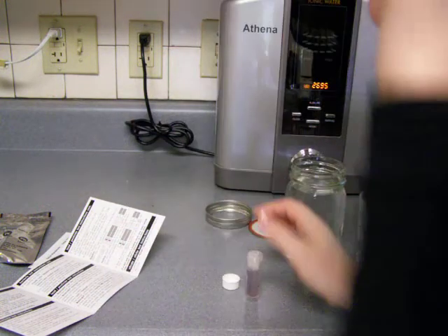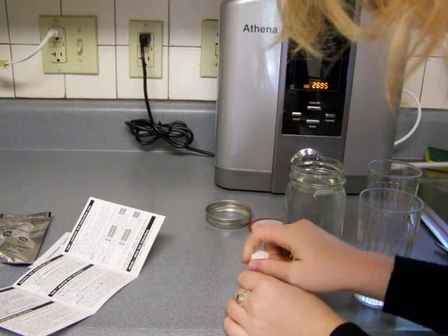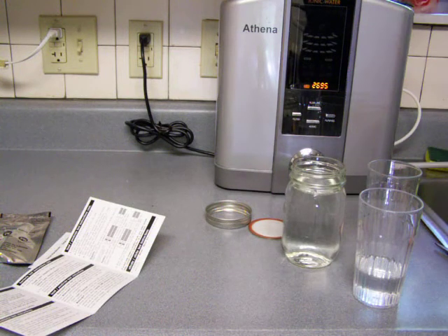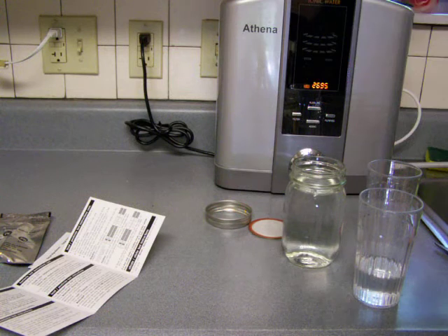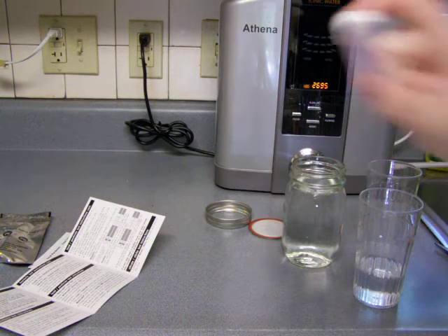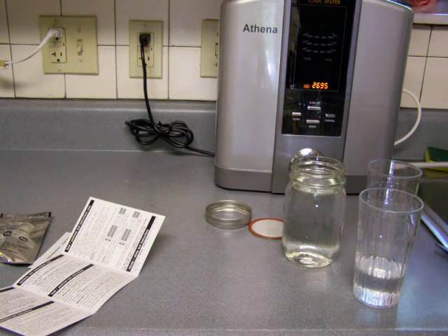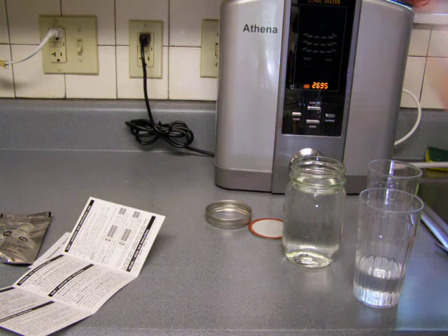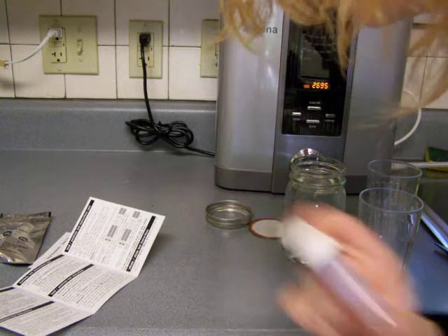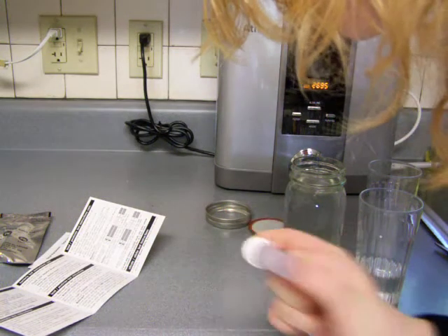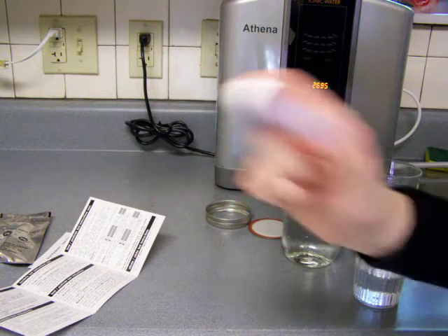Okay, so then it says replace the cap and twist on tightly. So I'm going to replace, shake the vial vigorously for 20 seconds. Okay, so then it says place the capped vial upright in a warm area where it cannot be disturbed for 48 hours.